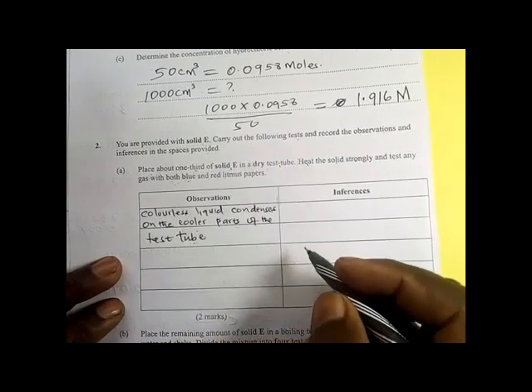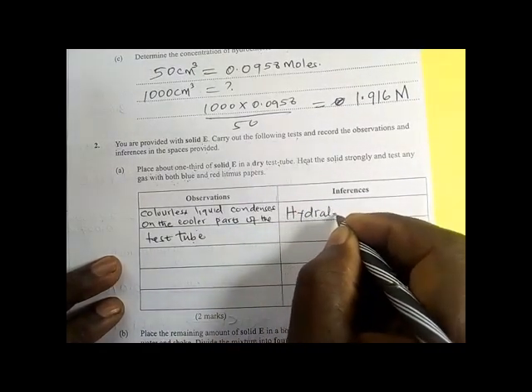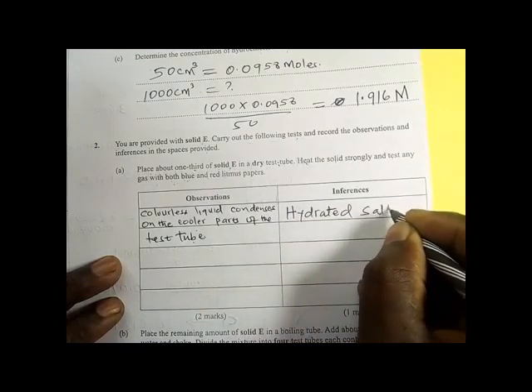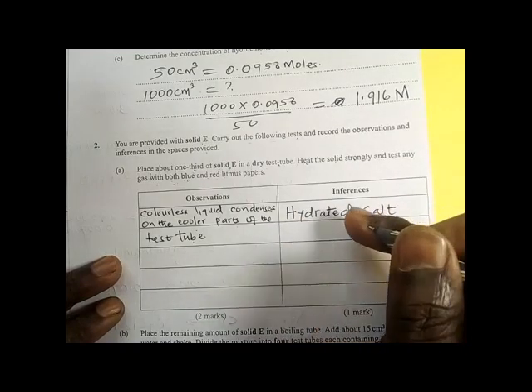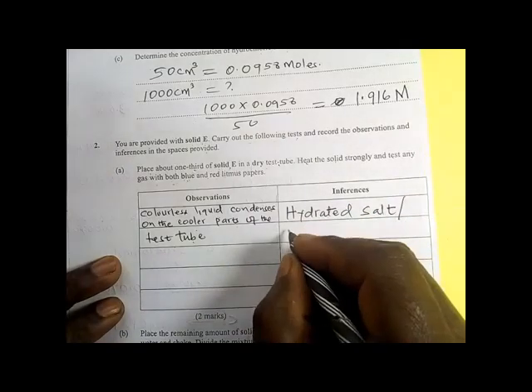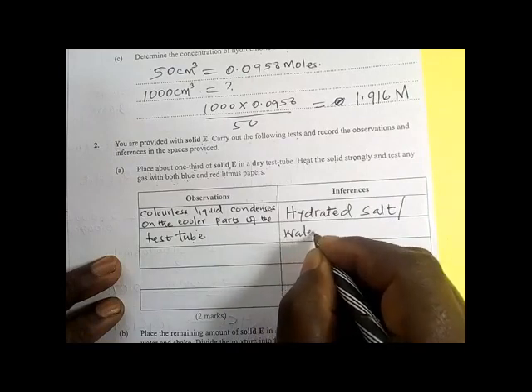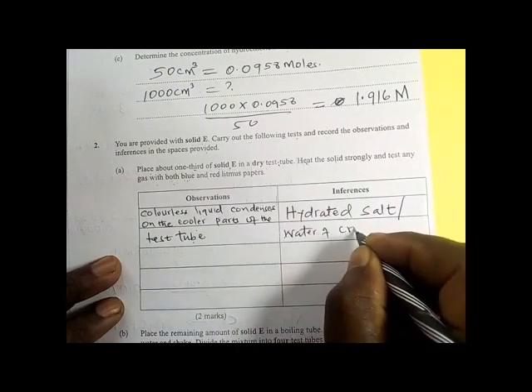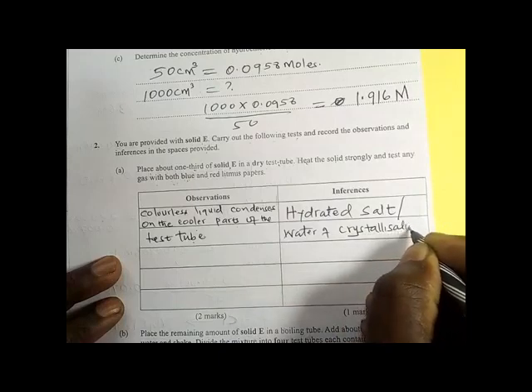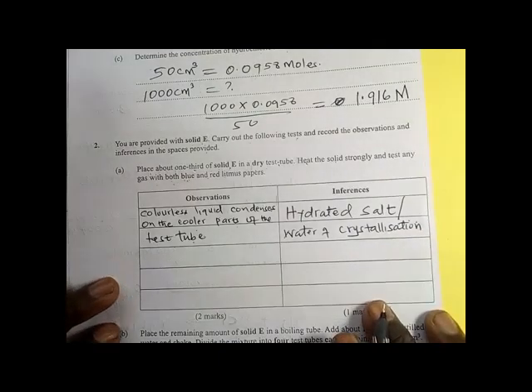This confirms that there is a hydrated salt — a salt which contains water of crystallization. So you can also say the salt contains water of crystallization.